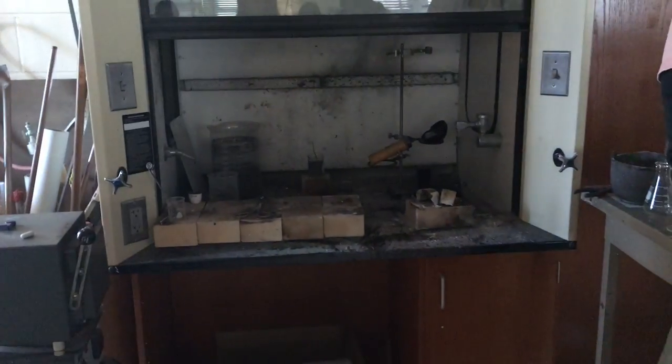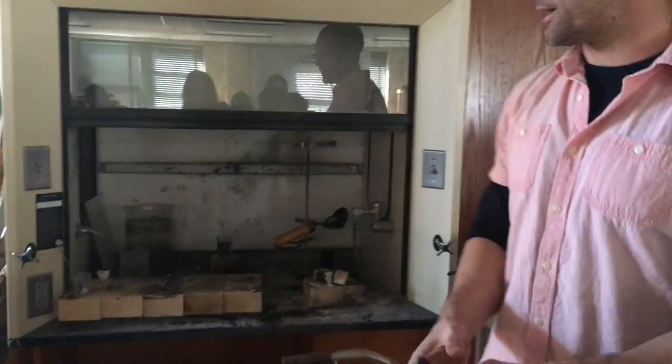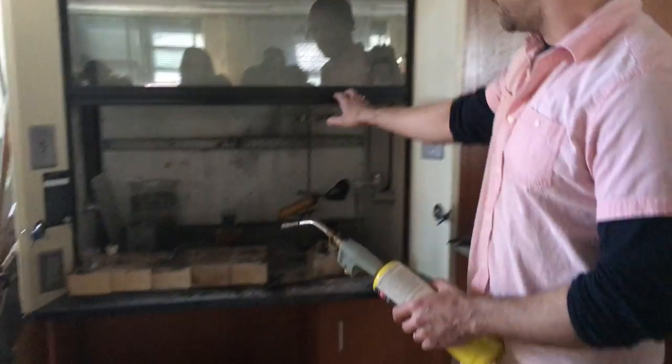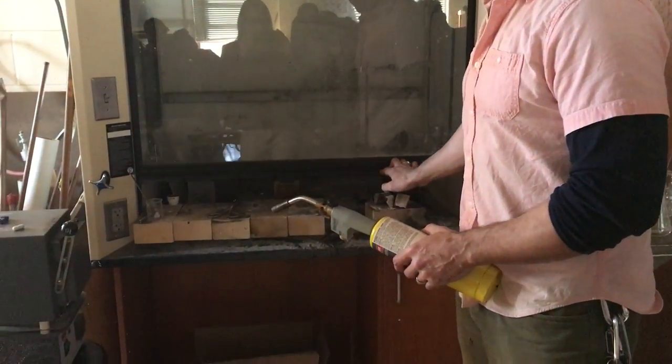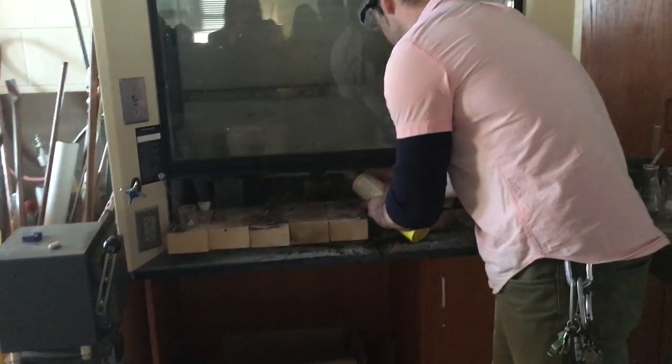Now here we go folks, this is going to be a single replacement reaction, a redox reaction: copper oxide and aluminum. And you're going to want to move back a little bit.